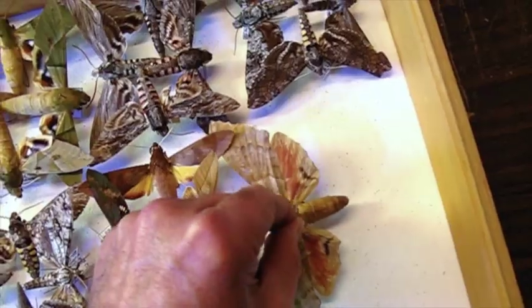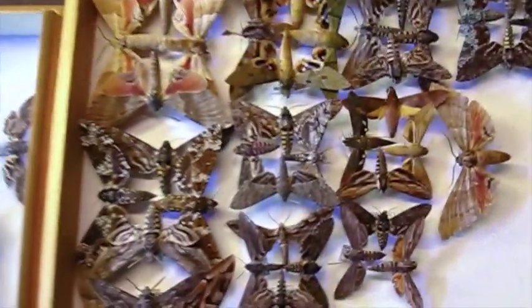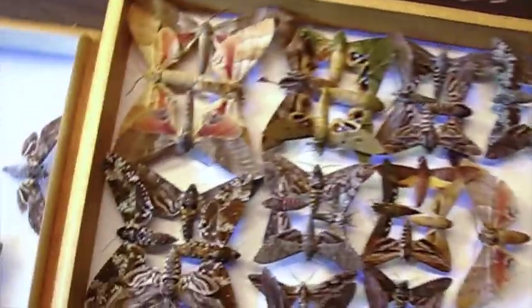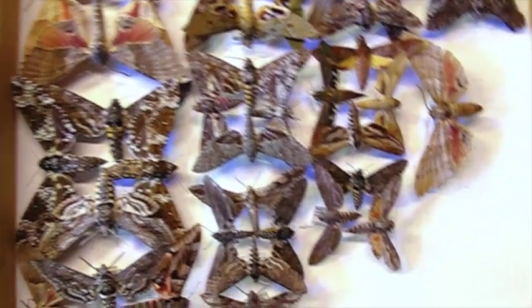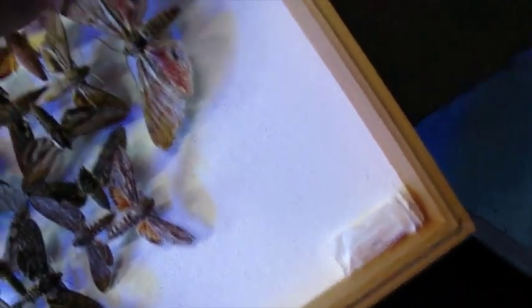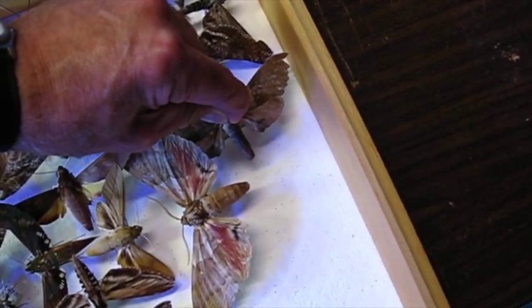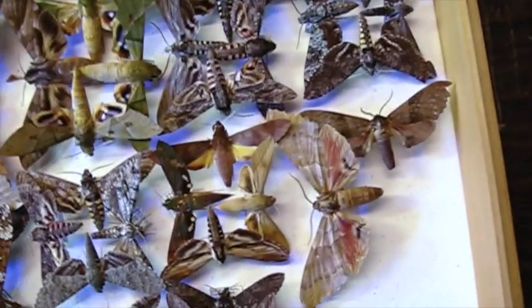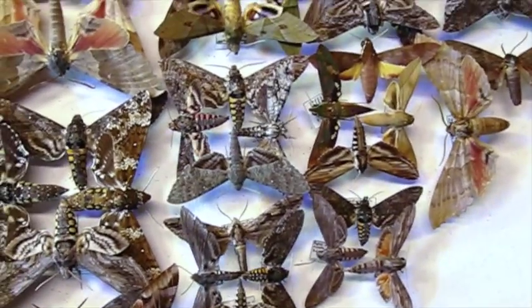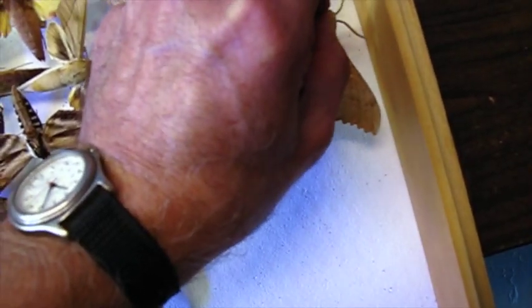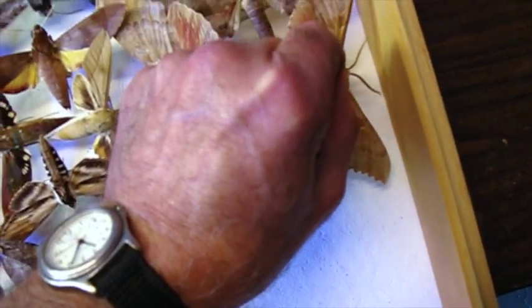Now I can put the ones that I've cleaned back in here. I have a teaching collection. This is just a storage collection for extra specimens. I sort of like this technique of arranging these sphinx moths like this. I can make best use of the space.